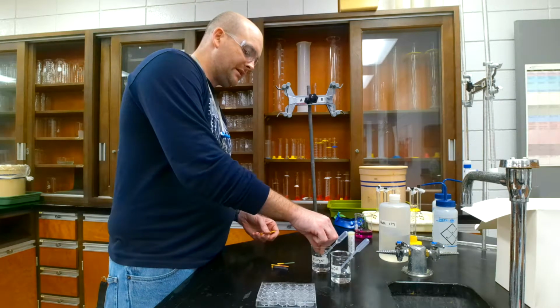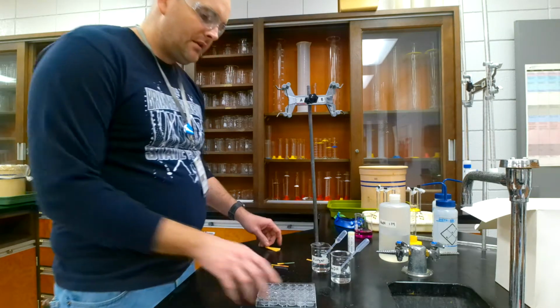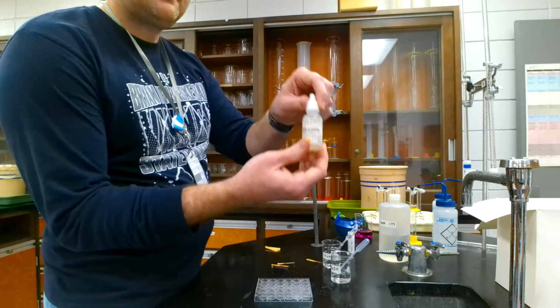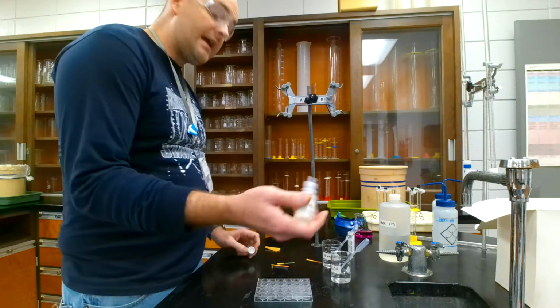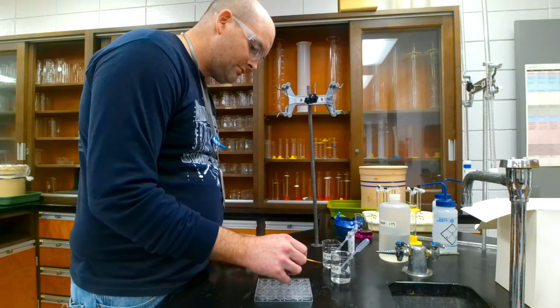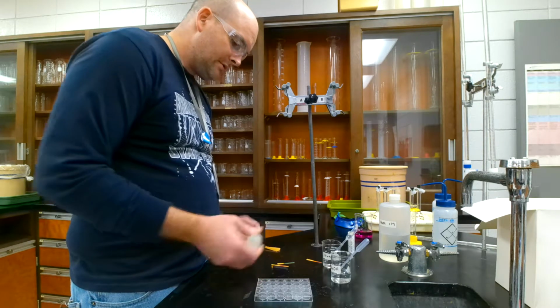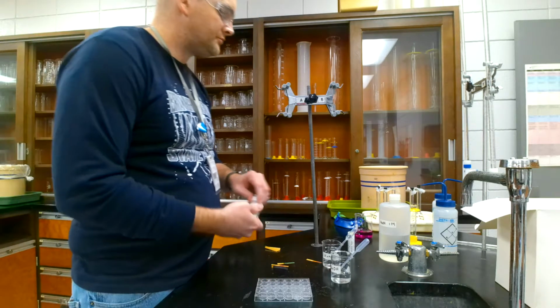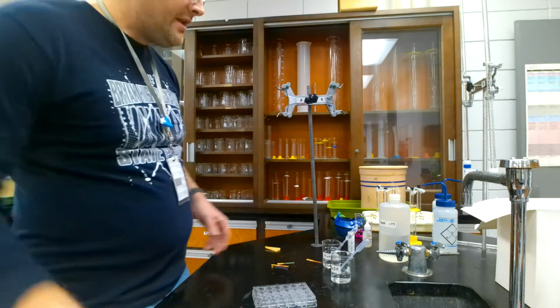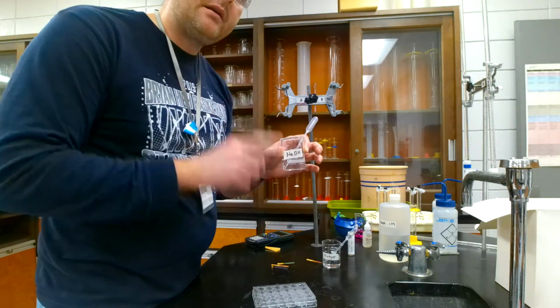I'll go ahead and prove to you again that it is red, so that is my acid, my vinegar. And now I'm going to add my indicator, my phenolphthalein. Okay? And I'm just going to add 1 drop to each well plate. Alright. We'll shake that up just a little bit to get it stirred up. And now I'm going to start adding sodium hydroxide and counting the number of drops.